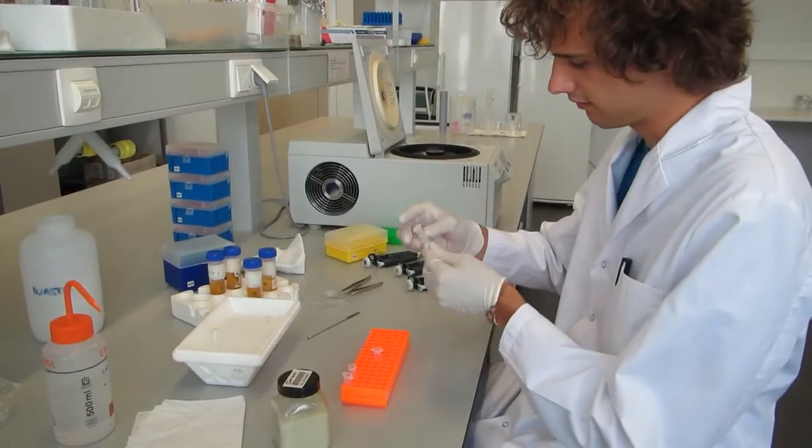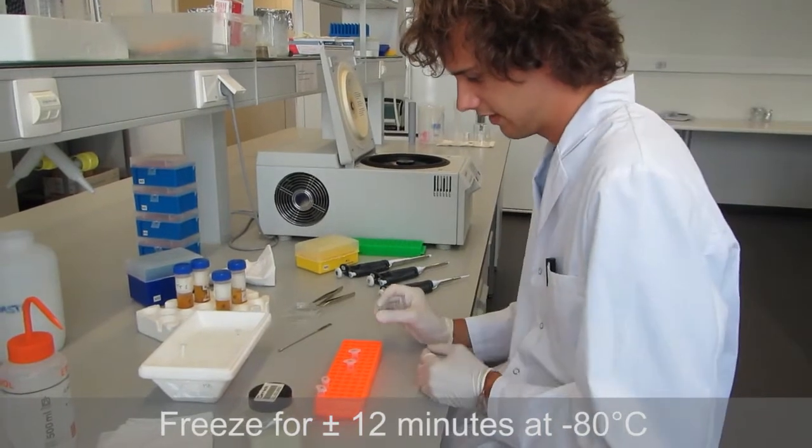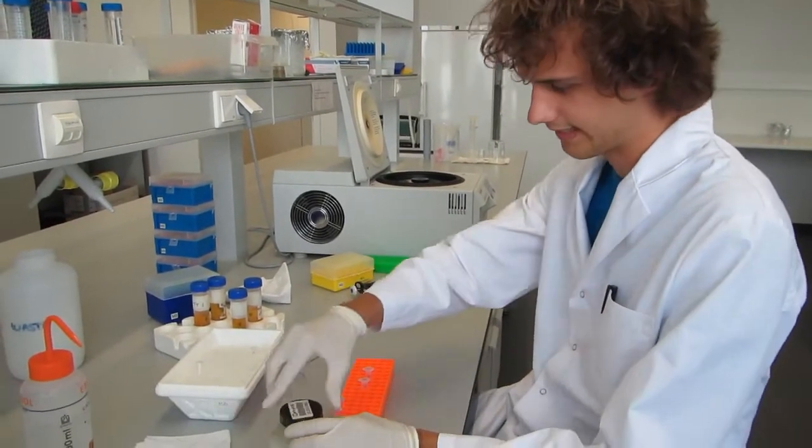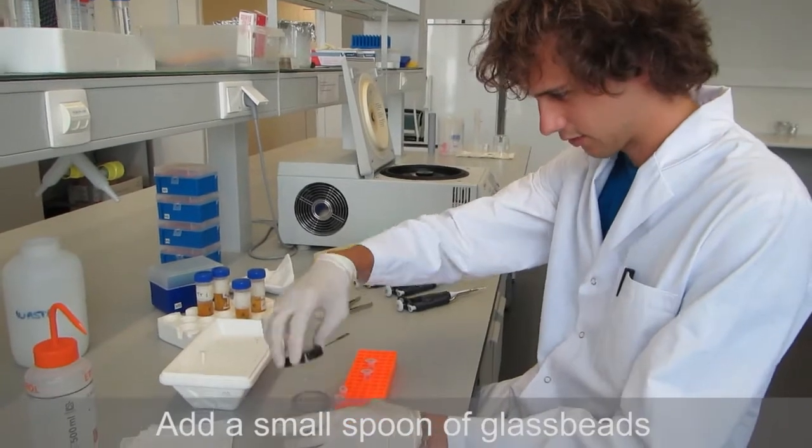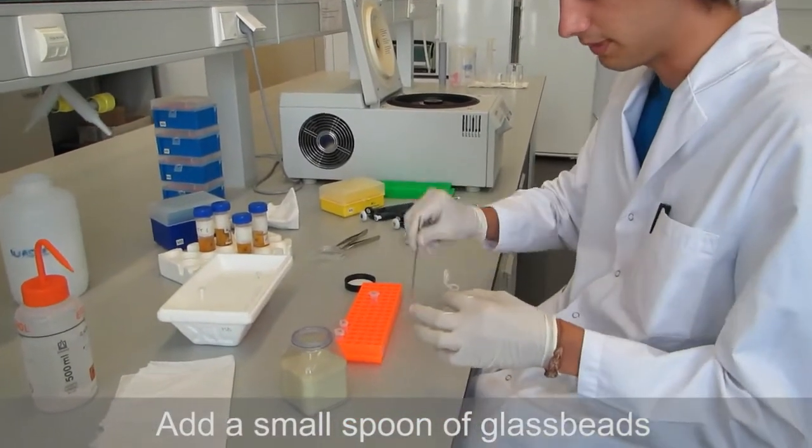So now we froze the tissue with the CTAB so the cells will be broken down. And now we will add some beads. Just a small spoon of beads.